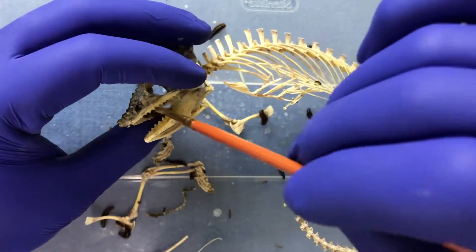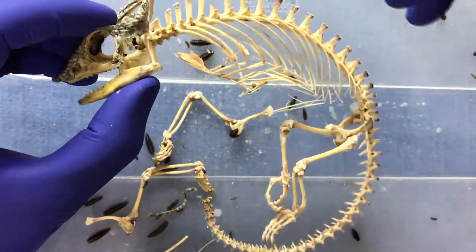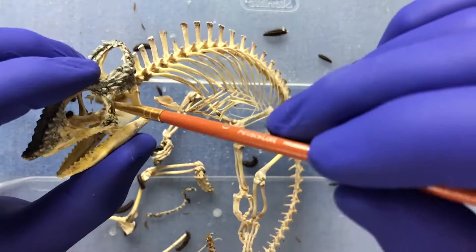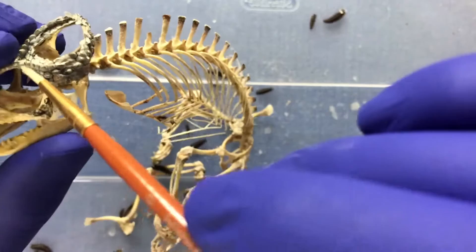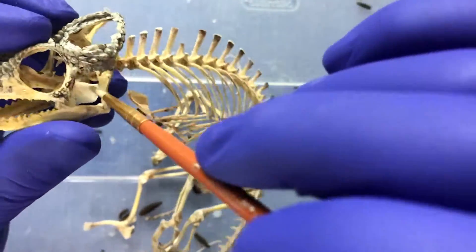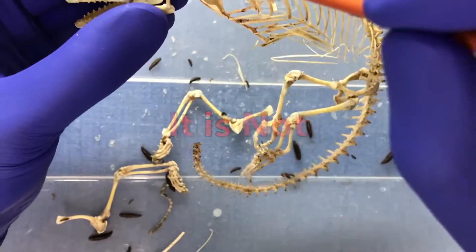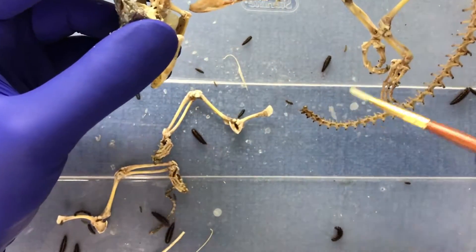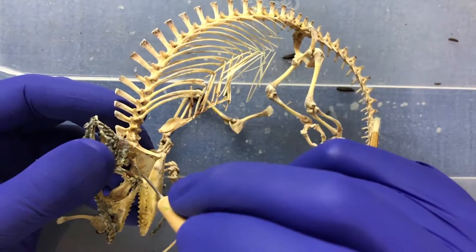Let's get these guys out. Lizards have an open brain case — the part where their actual brain would be right here — there's really not much around it, just a couple of wispy bone-like fragments. They do not have a solid brain case. I can't say it's a universal rule for all lizards, but iguanas, varanids, and chameleons that I've dissected do not have a closed brain case.